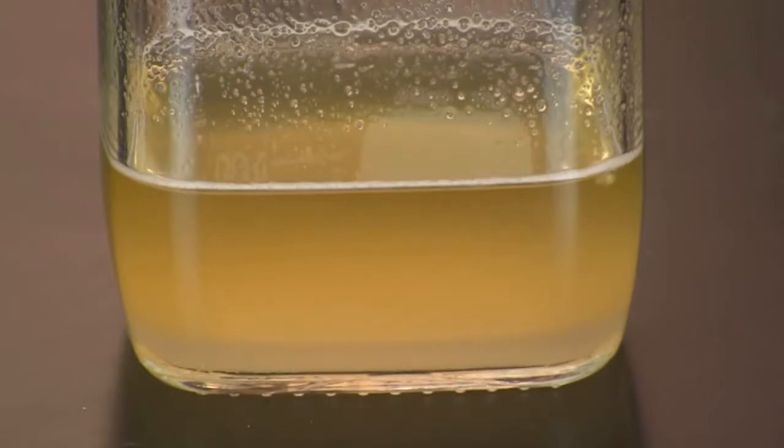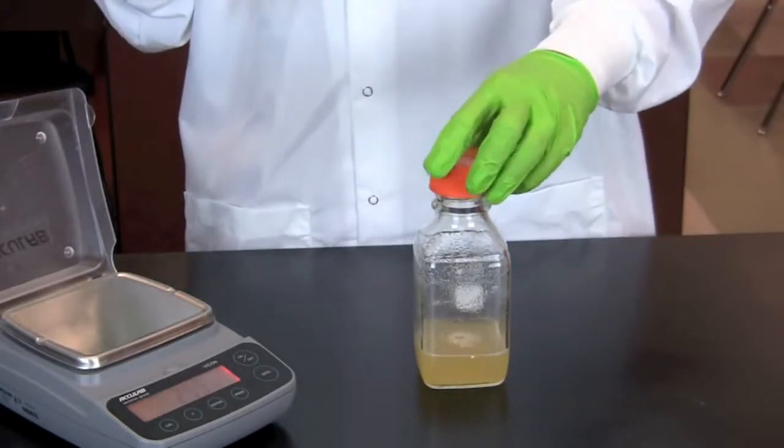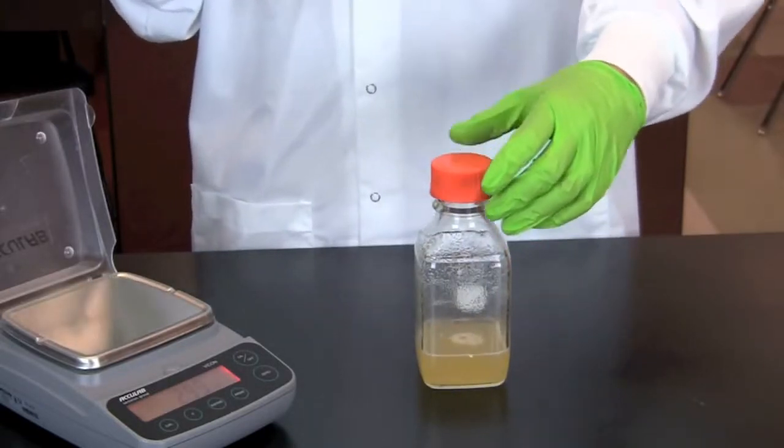Microwave the agar on a medium setting in 30 second increments for 1 to 2 minutes until it is clear. Make certain the cap is placed loosely on the bottle to allow steam to escape.